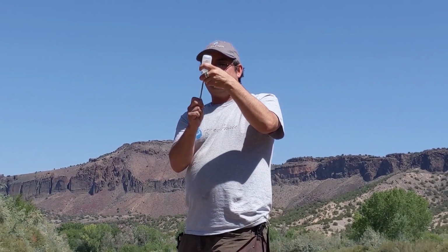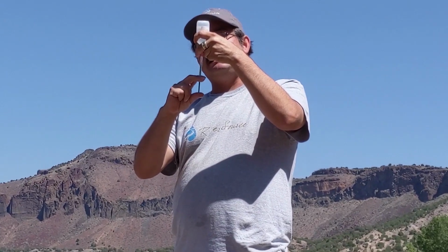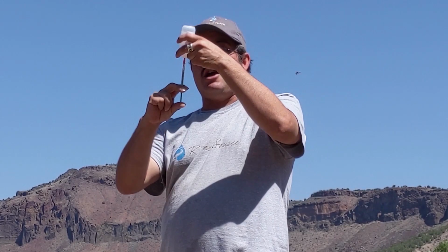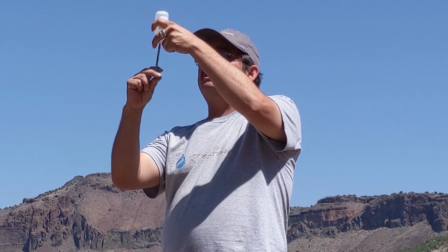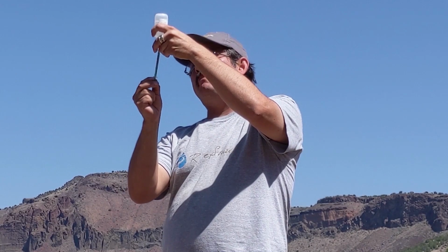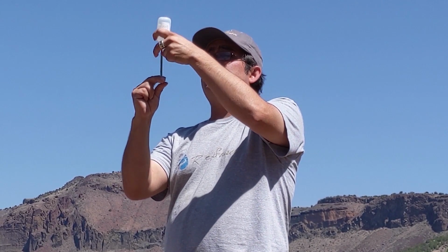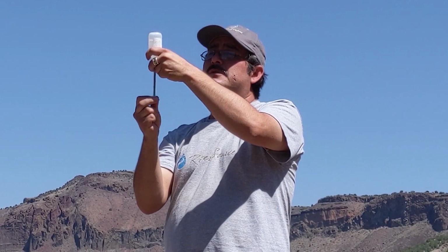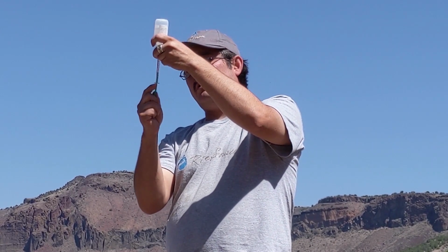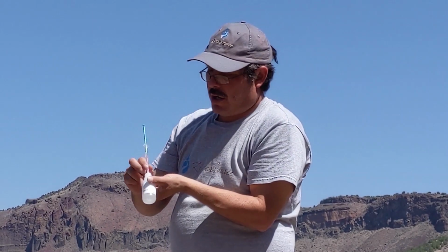Okay, so what I'm going to do is fill it up partially. And what I've noticed is as I start filling it, there's an air bubble present within that sample. So I'm going to push all the air up. I may actually do it twice because it looks like there's still an air bubble in there. That pushes the air bubble into the top of the bottle there. And then we fill up our titrator to the 0 mark.